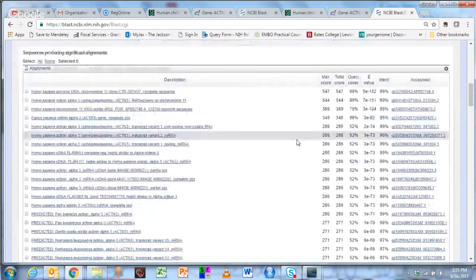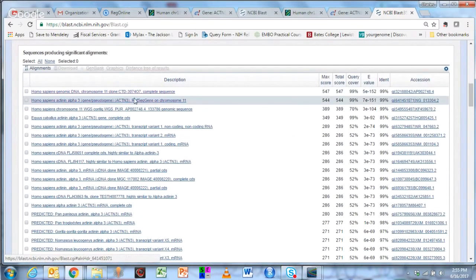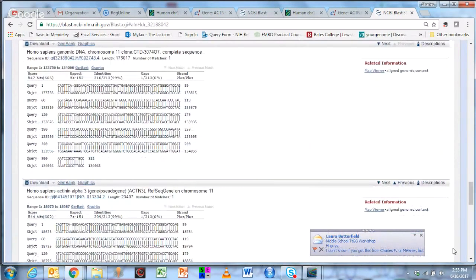If I scroll down, you'll see that it aligned to a clone somebody uploaded that has been determined to be on chromosome 11, and then a reference sequence, which is more important here. Let's look at this clone. You can see that this is our sequence, and here's our TGA. This is the stop codon. It turns out that the clone that was uploaded also had a T at that position, which would have been a premature stop in the ACTN3 gene.